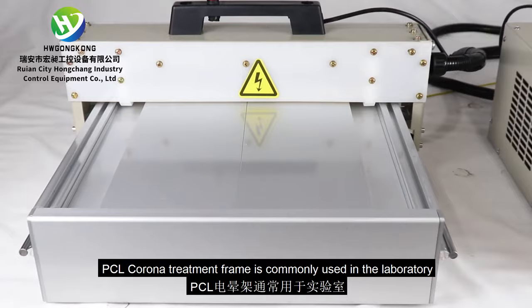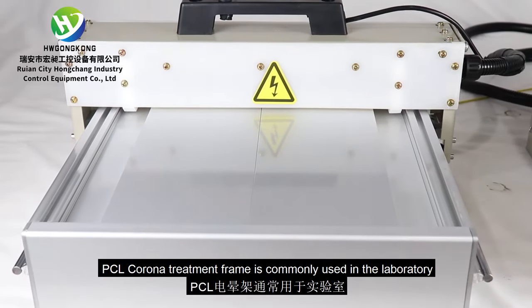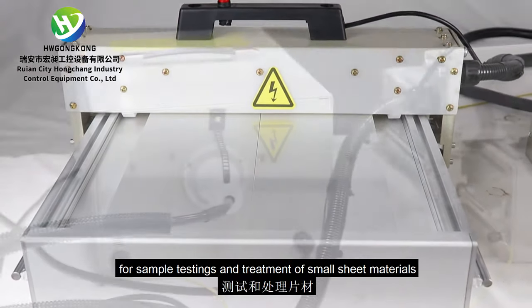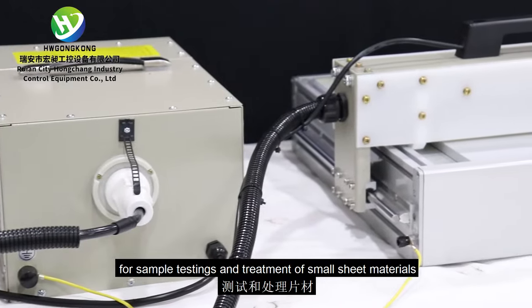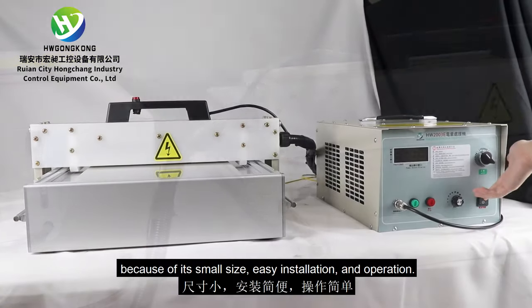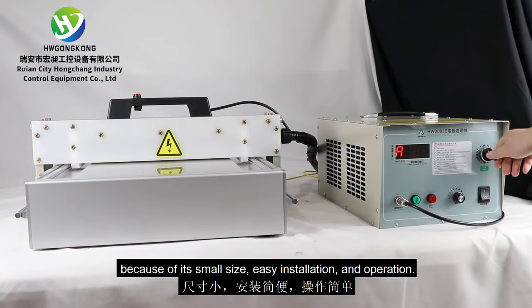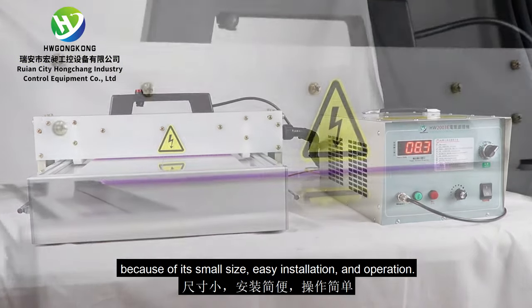PCL Corona Treatment Frame is commonly used in the laboratory for sample testings and treatment of small sheet materials because of its small size, easy installation, and operation.